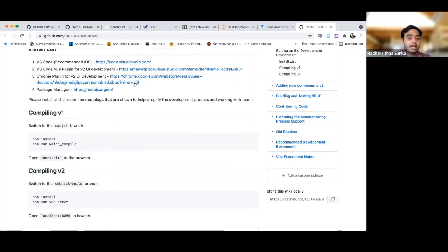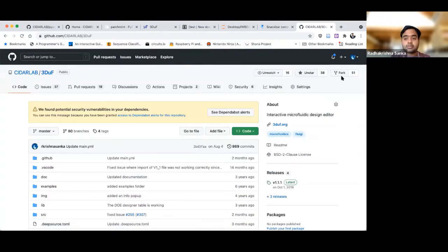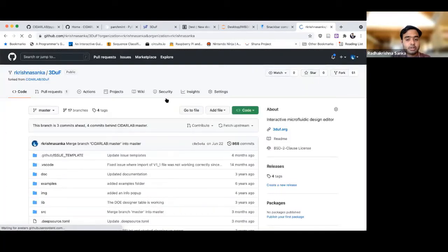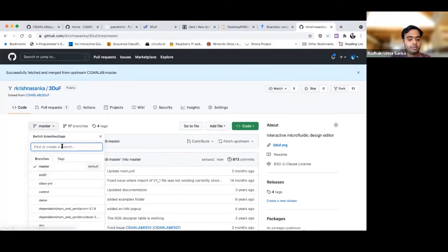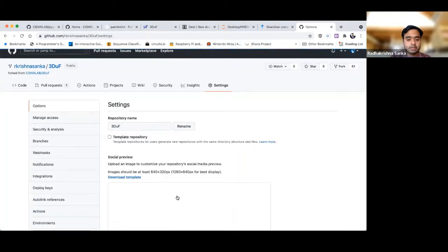So the other thing is, if you want to work on this, what you should be doing first is make a fork of the project. In my case, I apparently have the clone already. So I'm just going to go to my clone and fetch the upstream. Actually, let me just delete this and I will do this again.